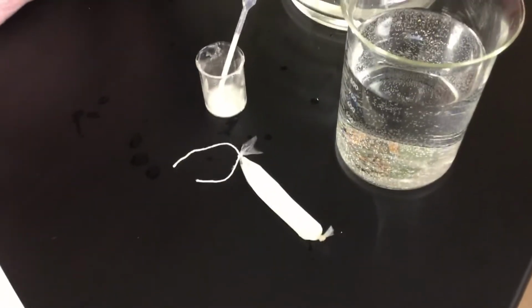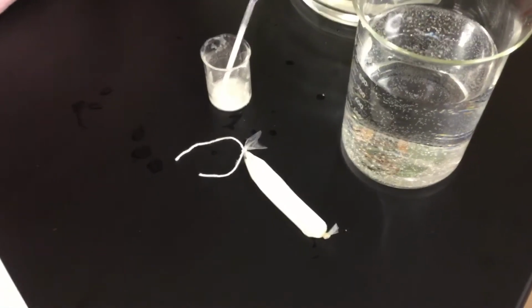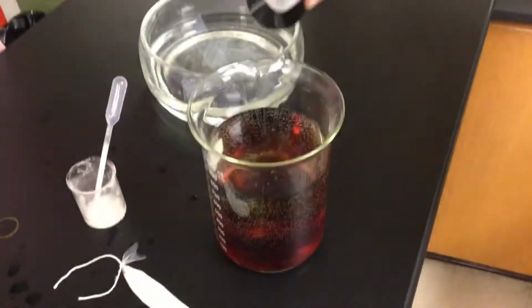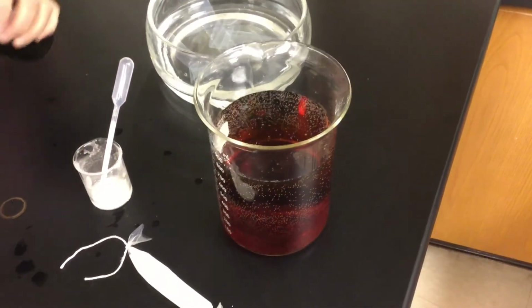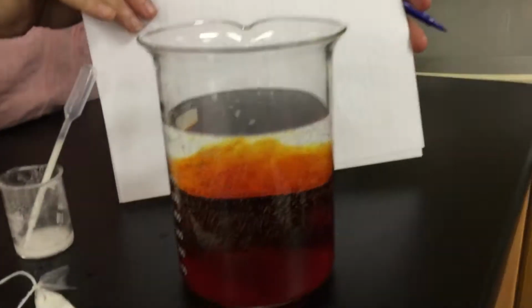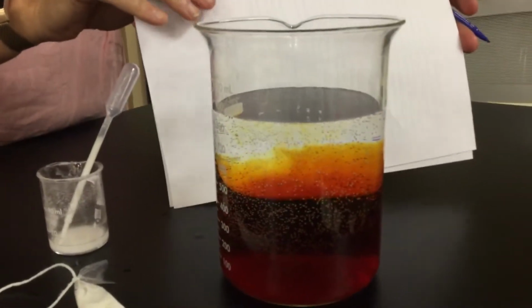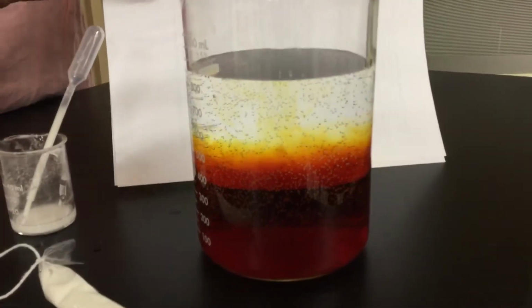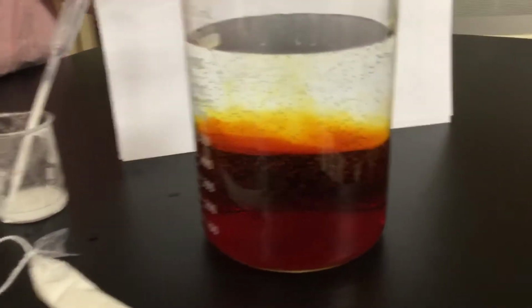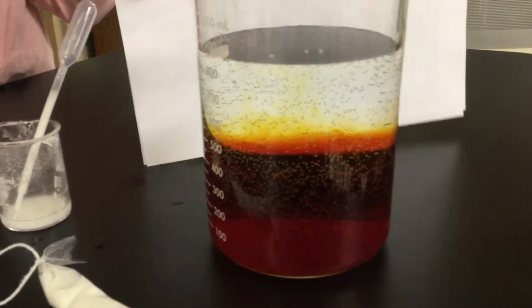We're going to be putting it into a solution of water and Lugol's iodine. This Lugol's iodine, once again, is going to test for cornstarch, so it will allow us to know if things are moving. We changed our solution to this orangey brown color, just so you guys can see. There's the color through it. Oh, diffusion. Iodine's moving through the water. It's going to reach equilibrium, so it's evenly distributed throughout, kind of like what we did with the color dye solution within the classroom as a demo.